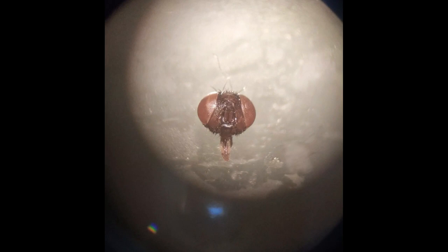We know that house flies have aristate antennae, but have we ever tried to dissect those? Here you are seeing the head of a house fly, which is already separated from the rest of the body. This is the frontal region of the head. Now, can you locate the antennae?